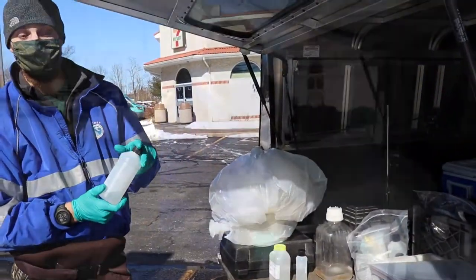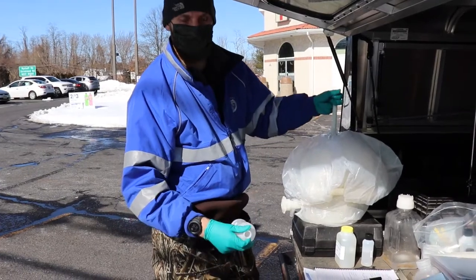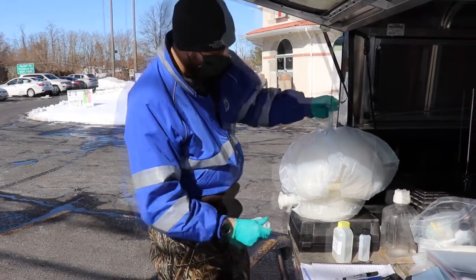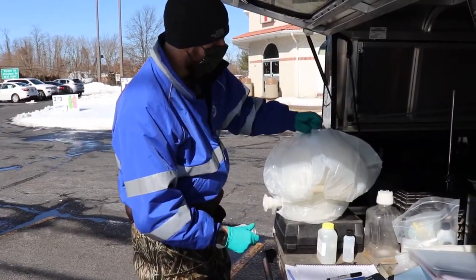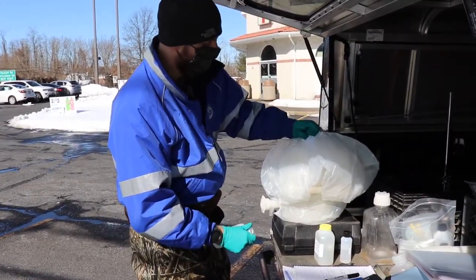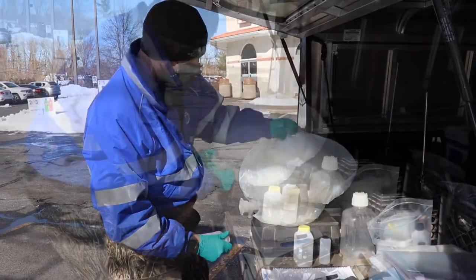Now these bottles are going to USGS. After I've done a pre-rinse of the bottle, I'll take the actual sample — again, churning within each time.